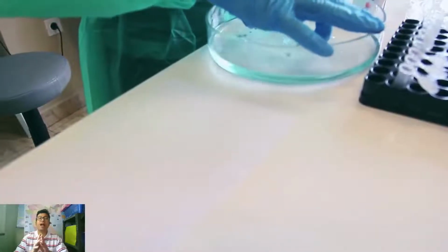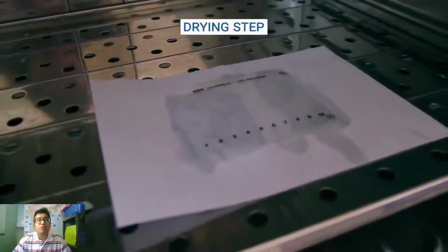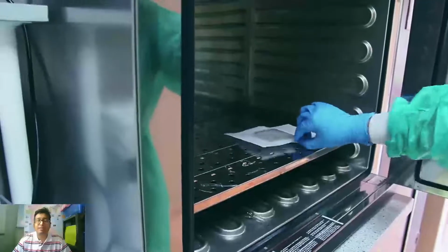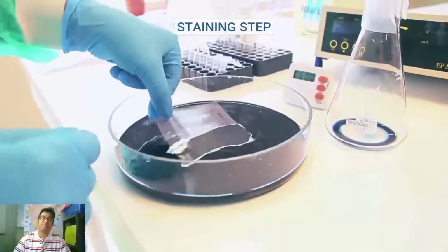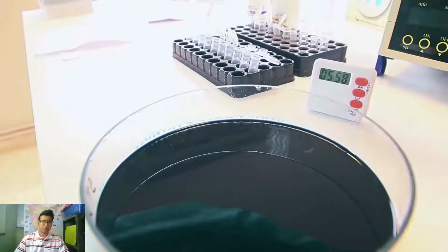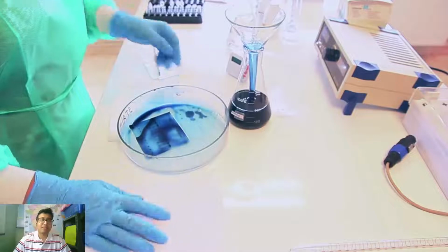Okay, after the protein is fixed, we need to dry the gel in an incubator. After it is air dried, we will place it in a staining solution for around 6 to 8 minutes.